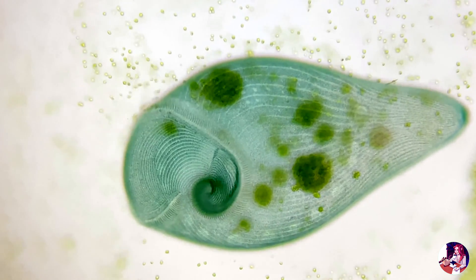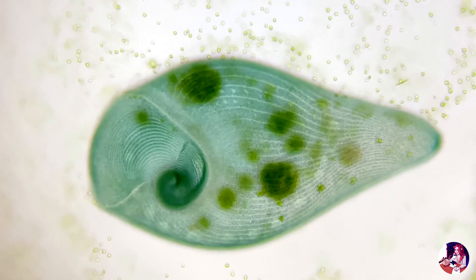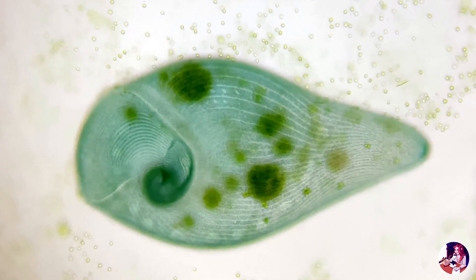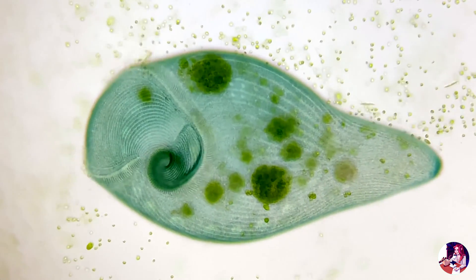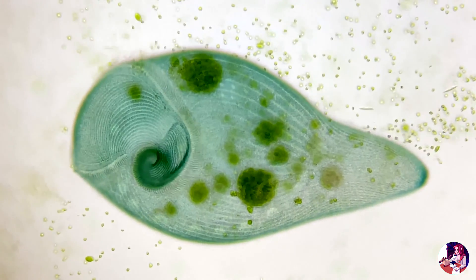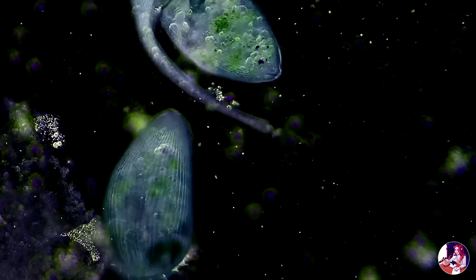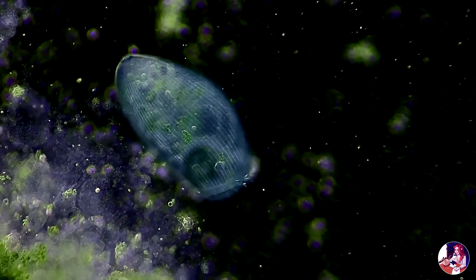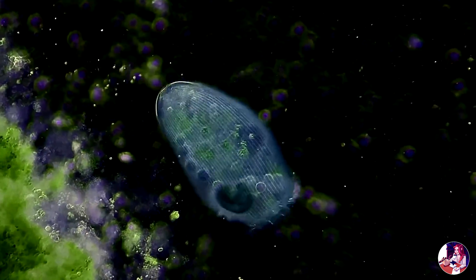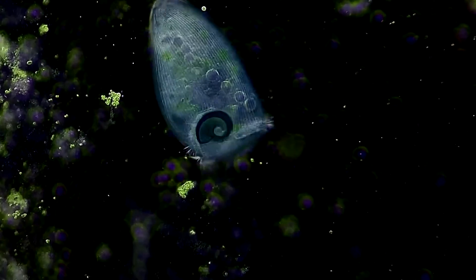The small white bubbles we can see form the macronucleus that contains the DNA necessary for reproduction and regeneration. The larger the individual is, the more copies of its whole genome it has, meaning it can regenerate from small pieces if damaged. Only a small piece of DNA is necessary to form a whole new stentor.